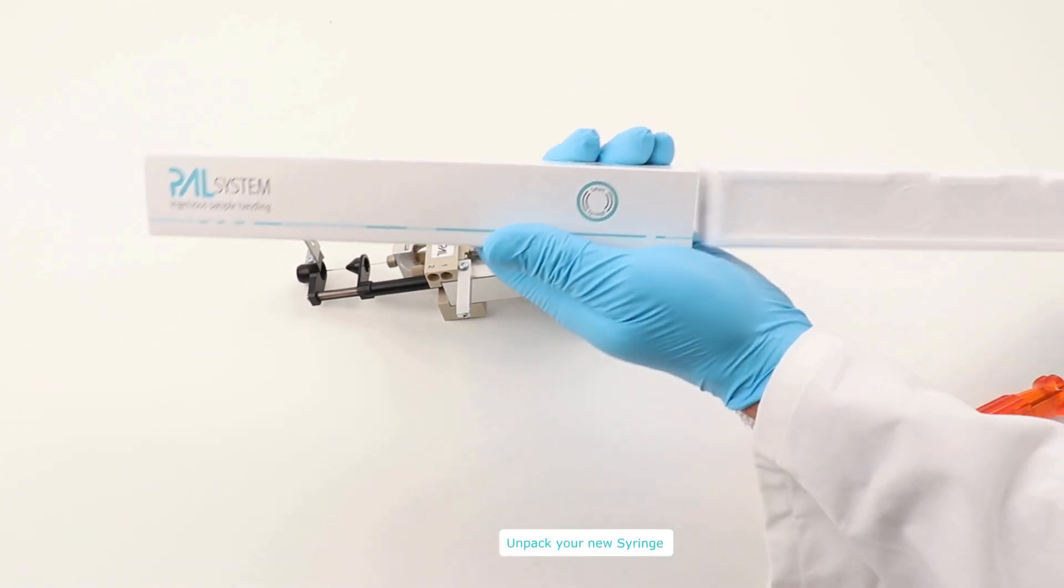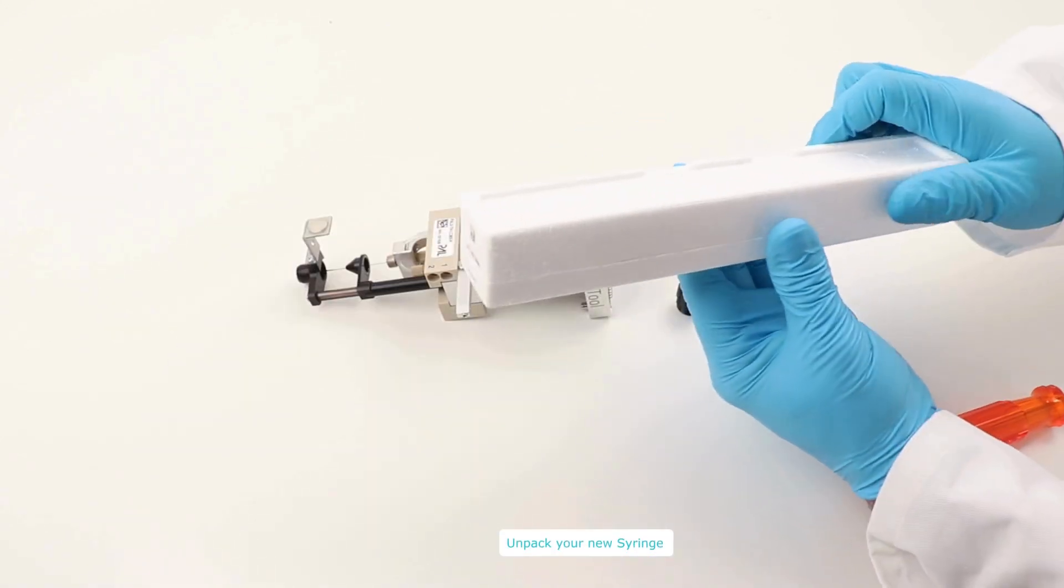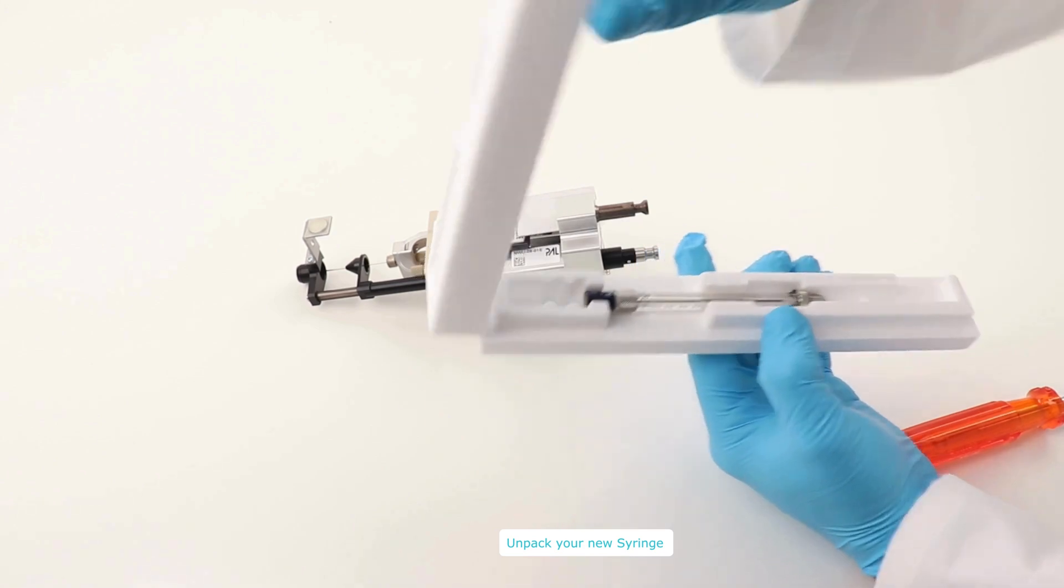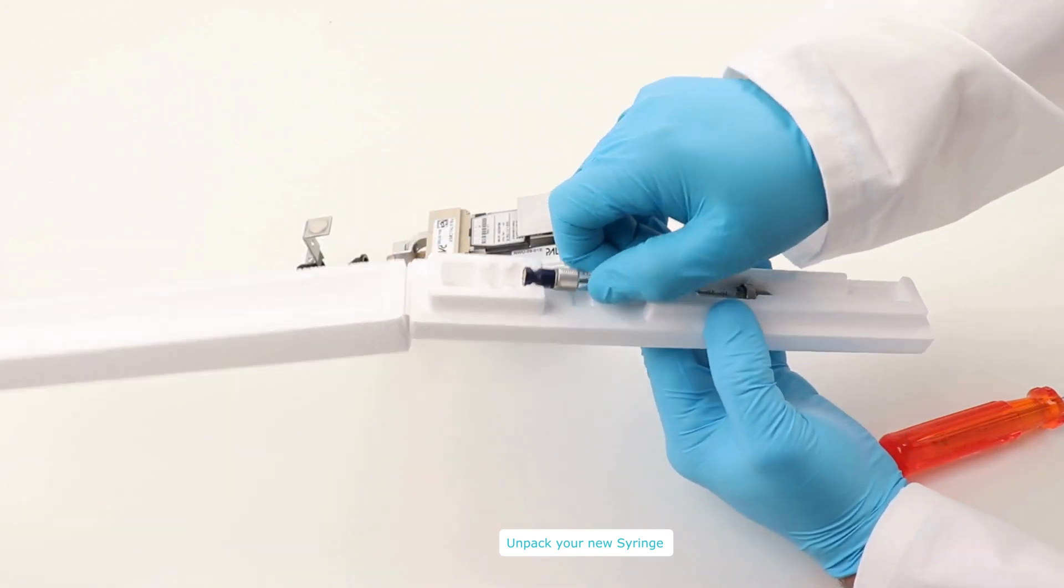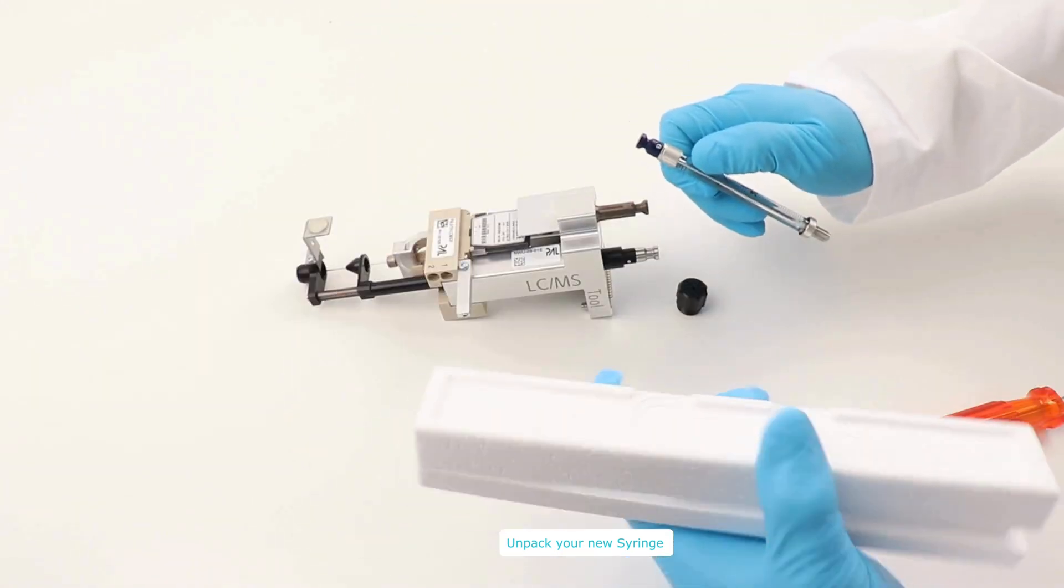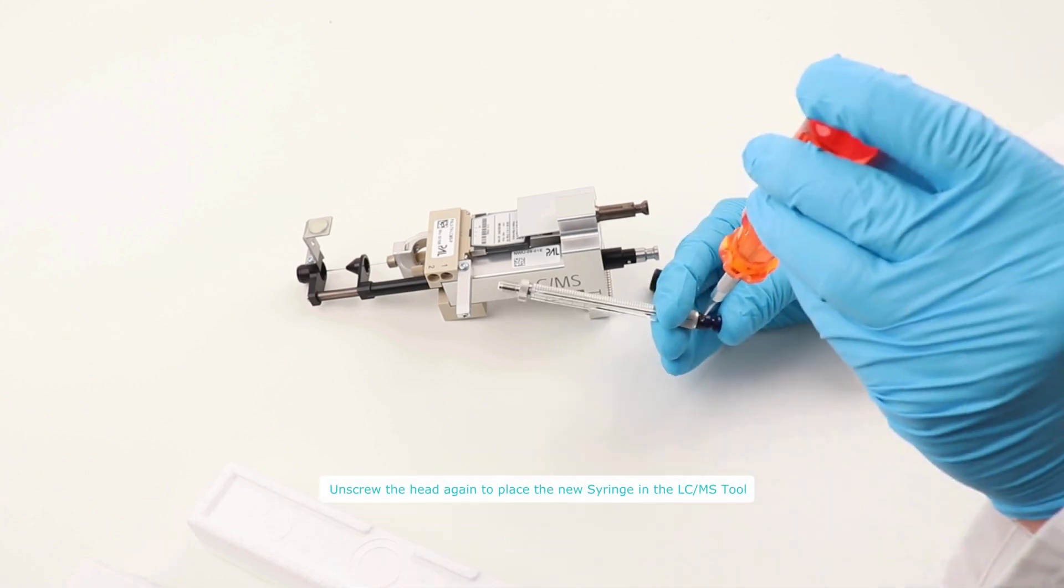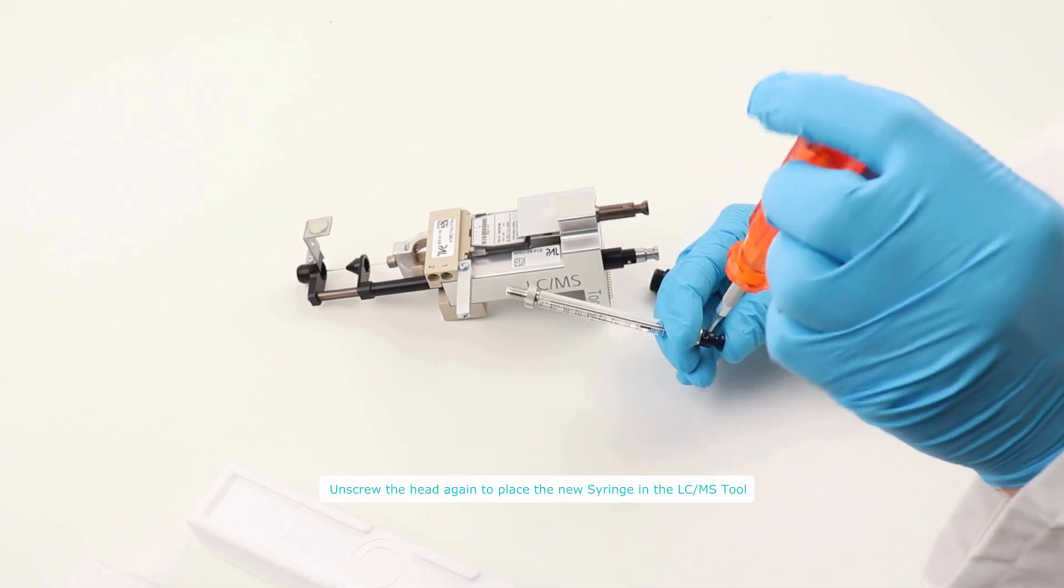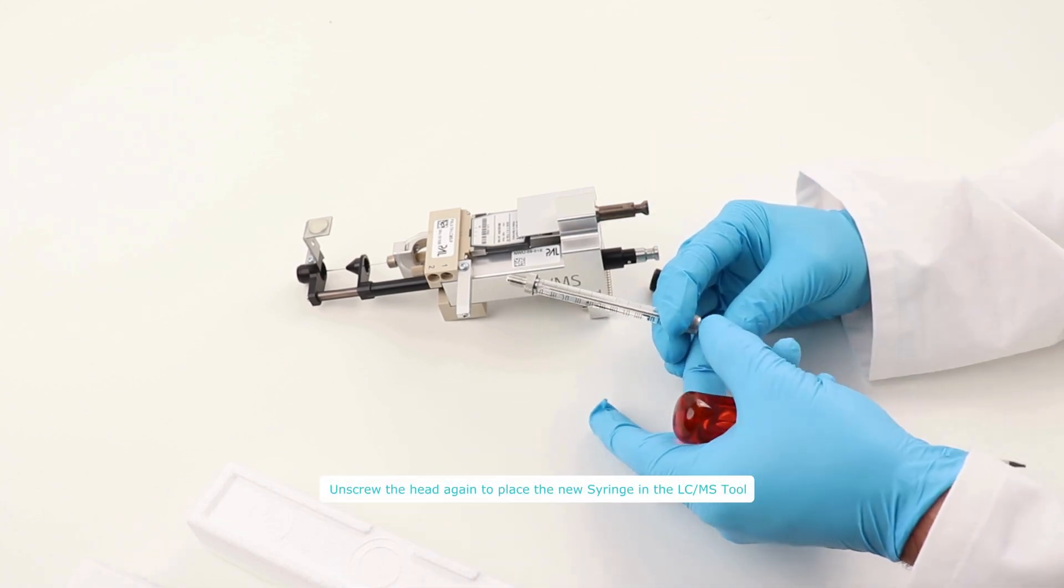Unpack the new smart syringe. Our LC-MS tools are available with 100 and 250 µL PAL smart syringes. With the T6 screwdriver, unscrew the head and remove it from the syringe.